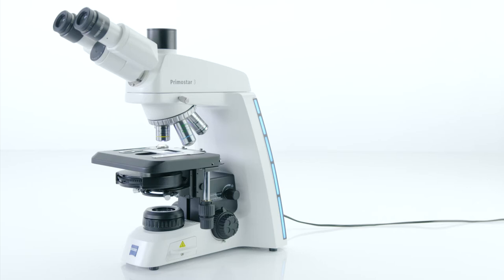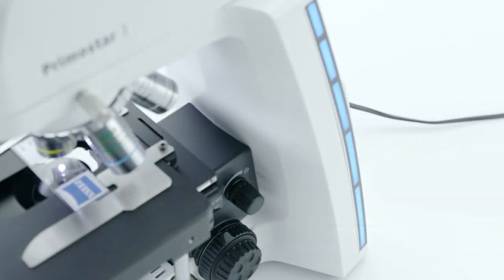Once the Eco Mode is activated, the microscope goes into a sleep mode for up to 30 minutes, so long as nobody touches it.